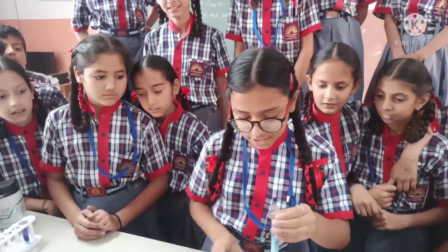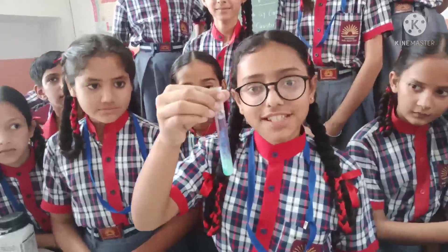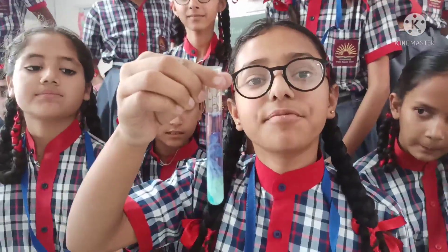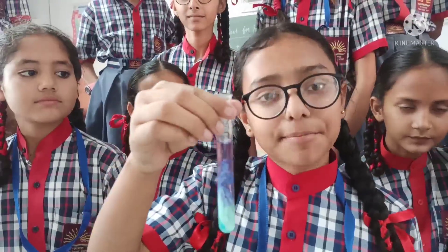Then we will shake it. Now, you can see the violet color — it indicates the presence of protein in the sample.